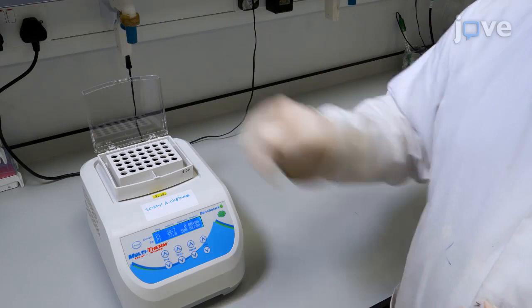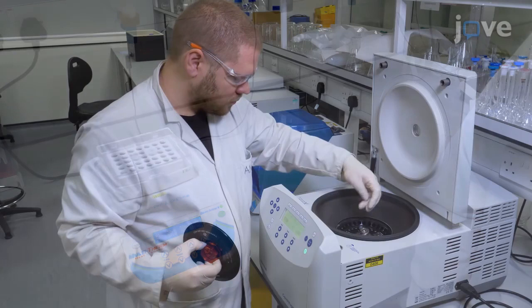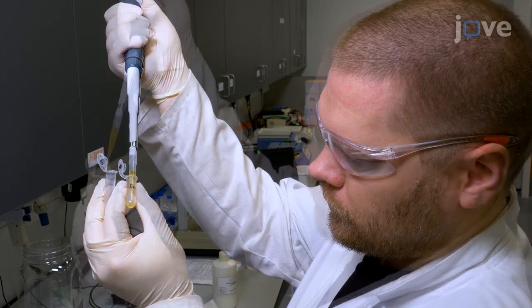Incubate one milligram per milliliter of nanomaterials in the human plasma for one hour at 37 degrees Celsius while mixing gently at 500 rotations per minute in a thermomixer. Then pellet the nanomaterials by centrifuging at 4000 times G for 15 minutes at 4 degrees Celsius. Collect the plasma supernatant for metabolite corona analysis and retain the nanomaterial protein corona complex for protein corona characterization.